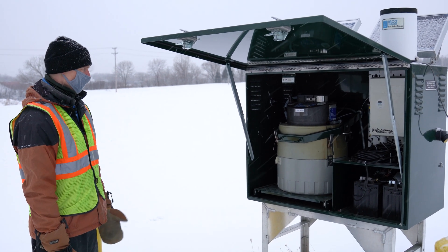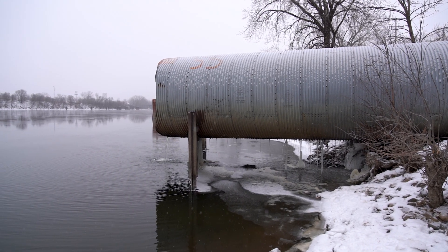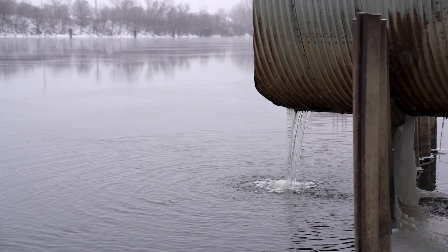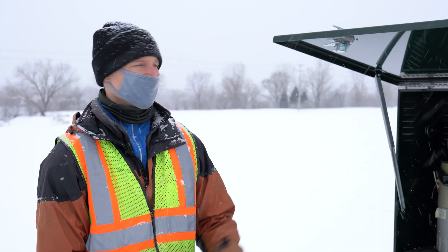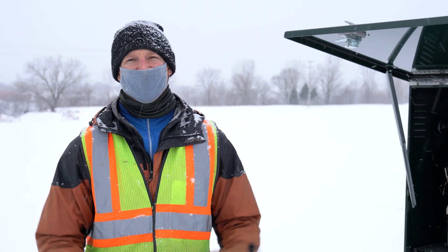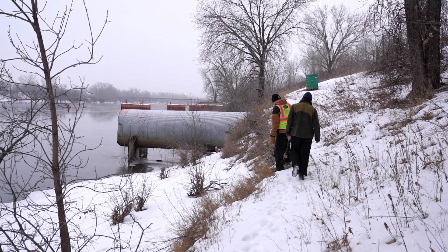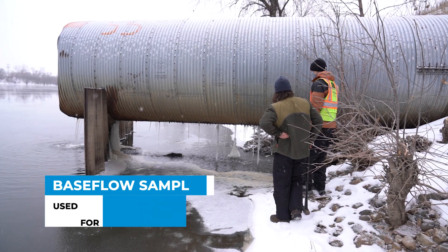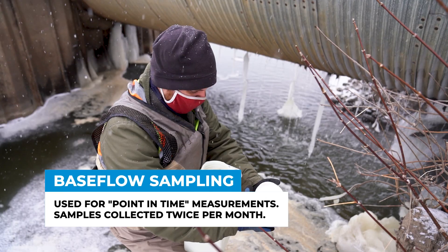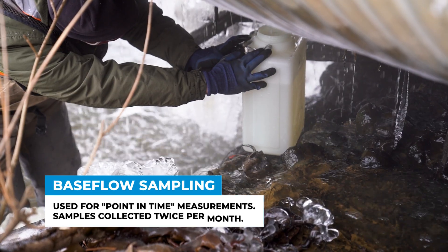We've also got an automated sampler. To collect the water sample from this site, there's two ways to do it. Either you let the equipment collect the sample for you and you come collect the bottles, or you walk down to the outfall itself and fill up a bottle to take to the lab. At this outfall, you just need to hold the bottle underneath the pipe so that it fills up with water.